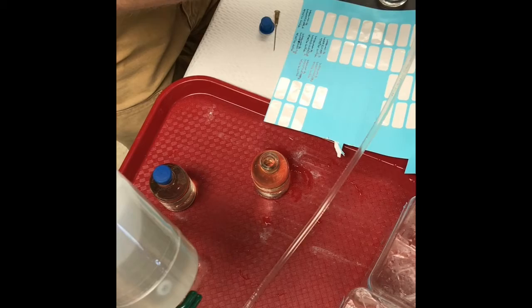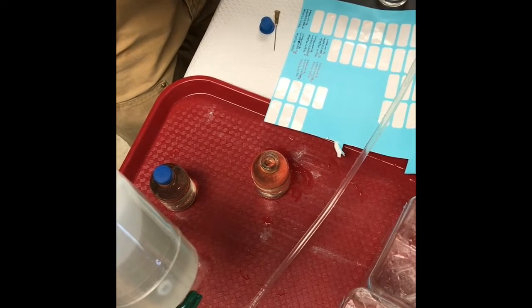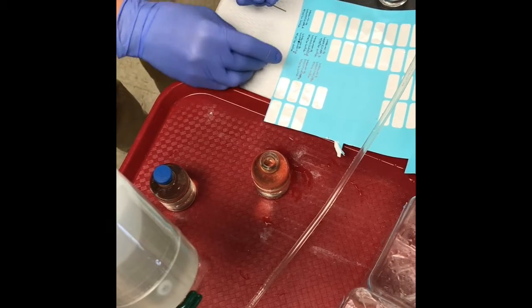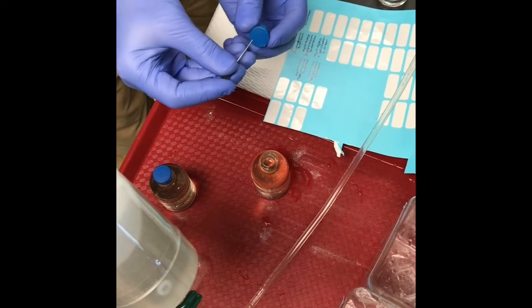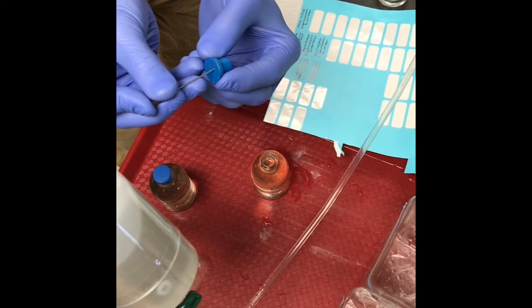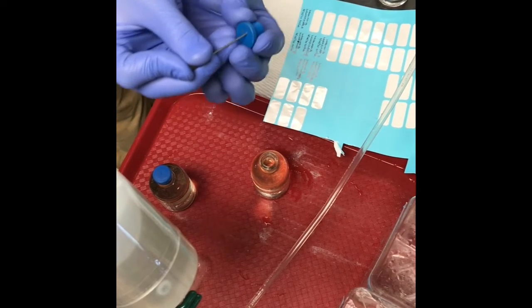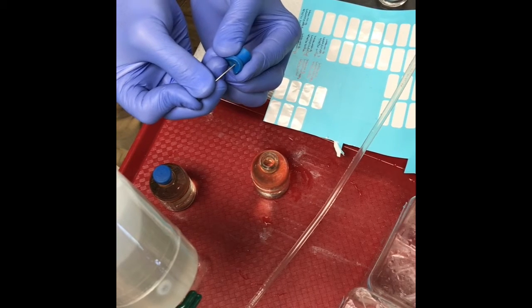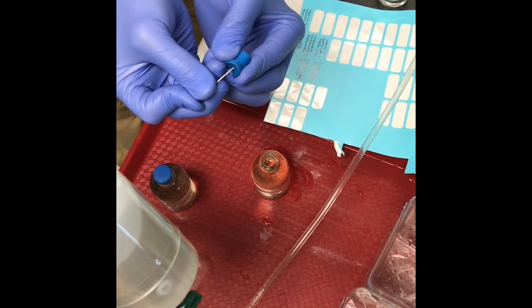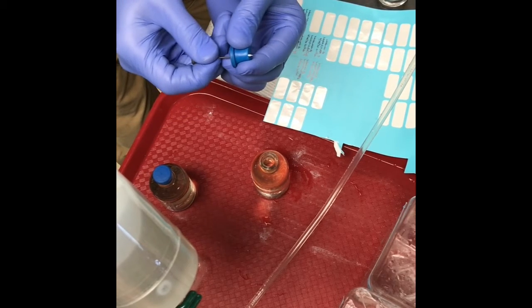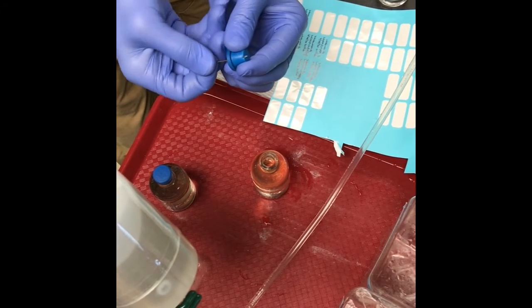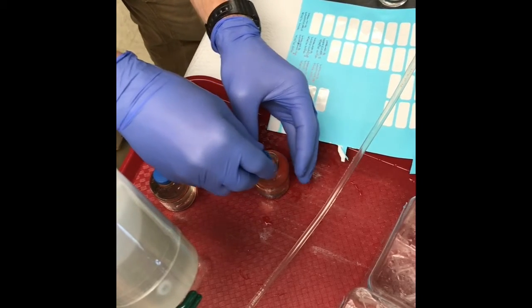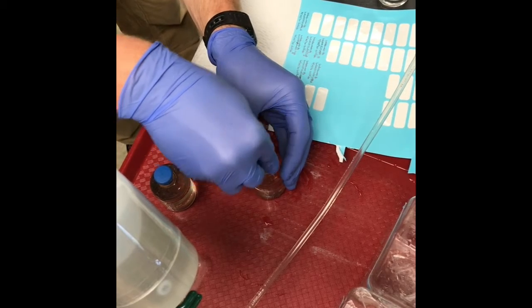Once it's full up to the brim, I'm going to grab a clean rubber stopper. This bottle is already preloaded with zinc acetate. I'm going to put the needle into the rubber stopper and have it come out towards the corner, right near the edge, so that any trapped air will be pushed out through the needle as I'm inserting the gas-tight lid.